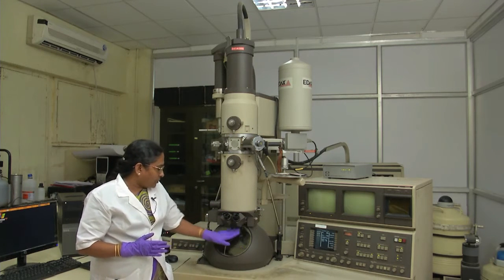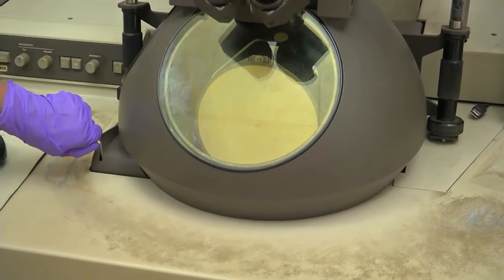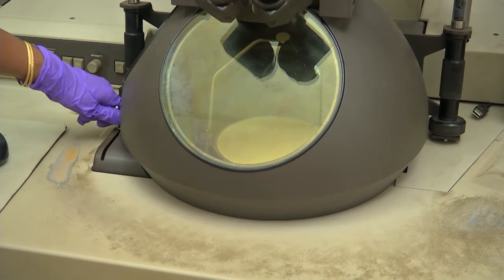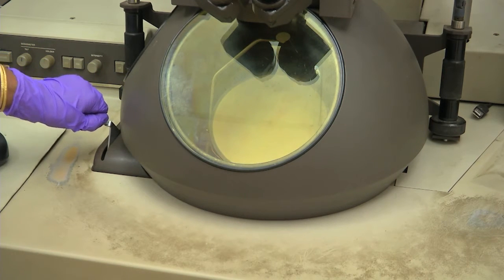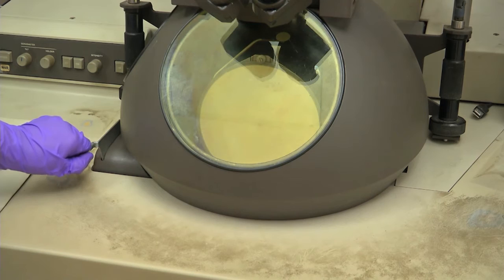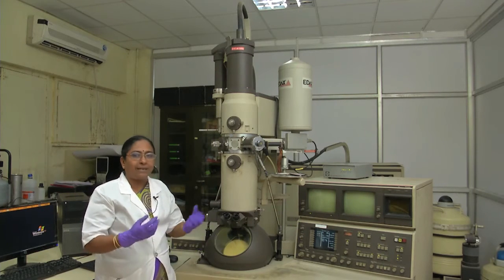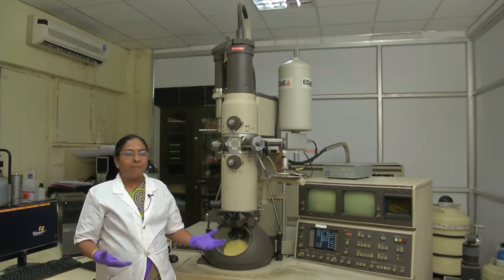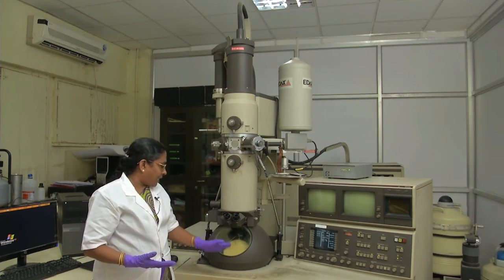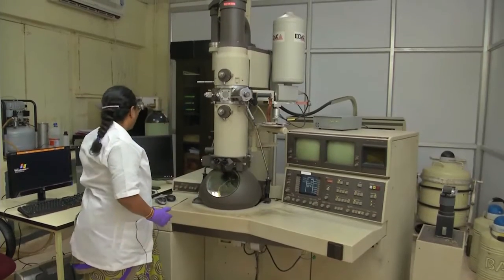What you are seeing here is a screen — this is the fluorescent screen. There is a disc in there that is the fluorescent screen. You cannot see the electron image with your eye directly; the electrons must hit the fluorescent screen, which then glows so you can see the image details. From this we can capture the image using a CCD camera, and you can see that image on the monitor.